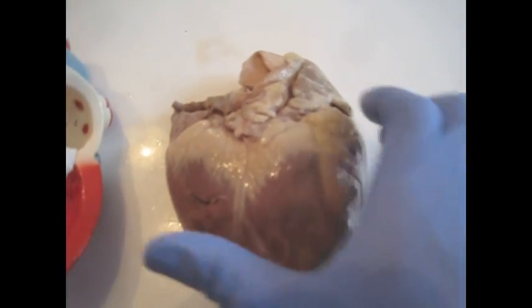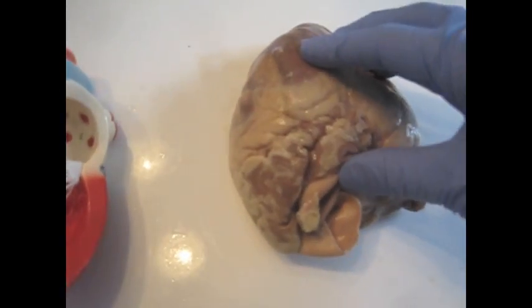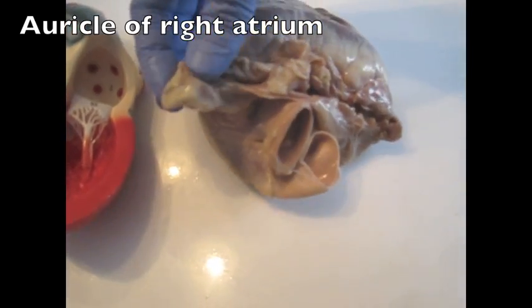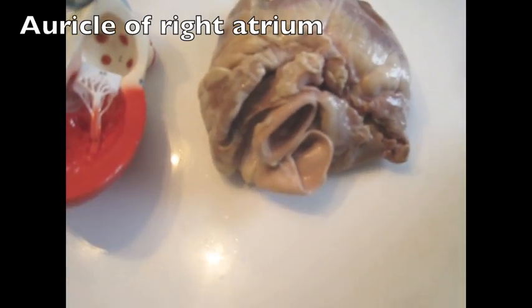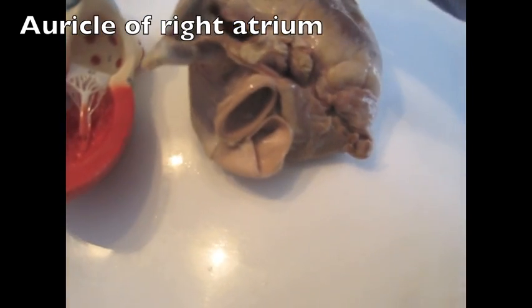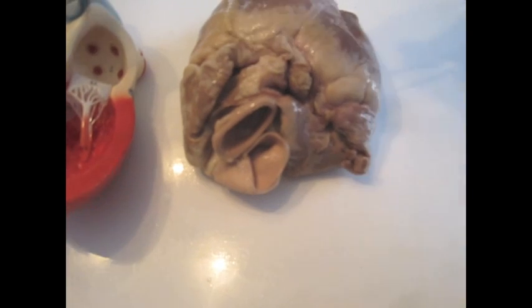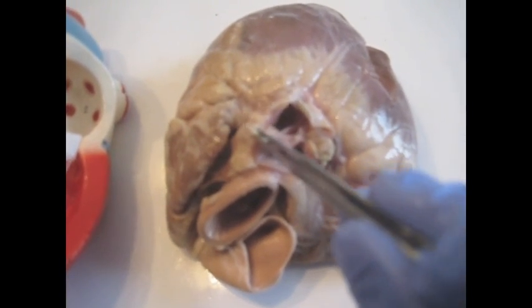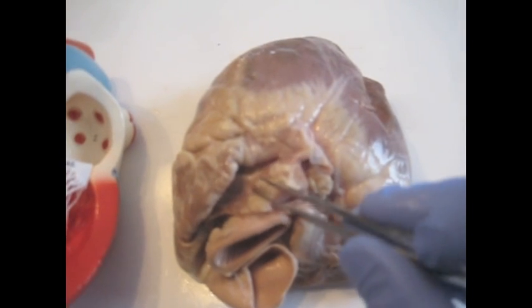Now that we know the top, bottom, left, and right side of the heart, we can work through the features of the right side of the heart, following the flow of blood. The upper chamber that blood first enters is the right atrium. This is the auricle of the right atrium. Here we're looking down into the right atrium through the superior vena cava, one of the main veins that feeds the right atrium. There's also an inferior vena cava, the other large vein that feeds blood into the right atrium.